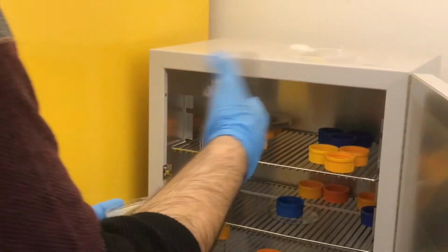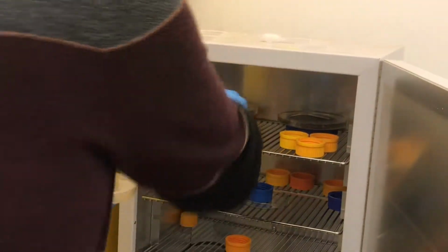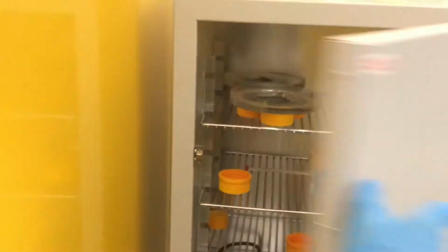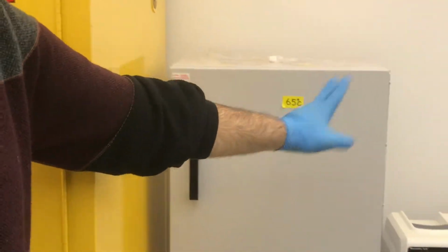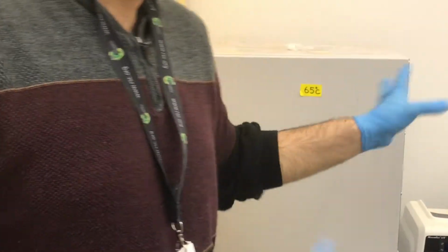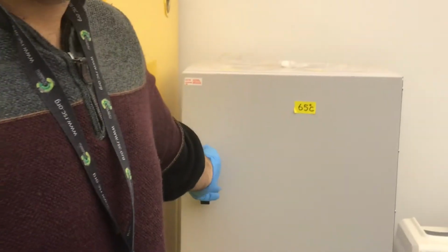Can I see, Ali, how it is? Okay, so can I take this one? Yeah, two things are important here. Do not talk at all when you remove the cap, because if you talk, air goes inside and the chip has bubbles. The other thing, you should do this part very fast, because if you do it slowly, air goes inside again. We should avoid any air going inside this thing. Okay, so now again I will open it.